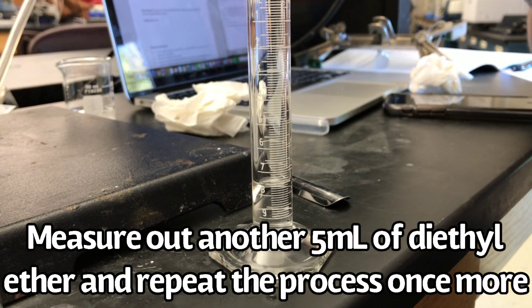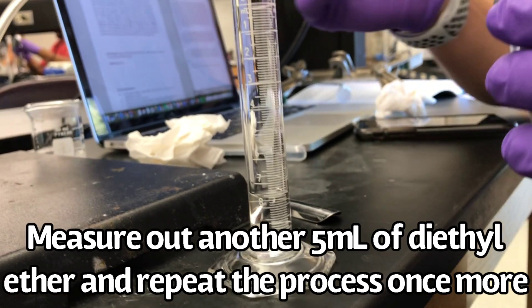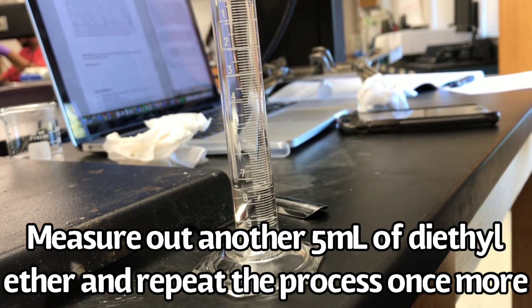Measure out another 5 milliliters of diethyl ether and repeat the previous process once more.